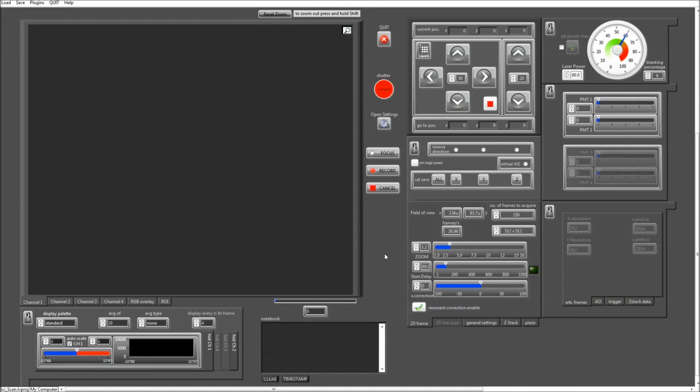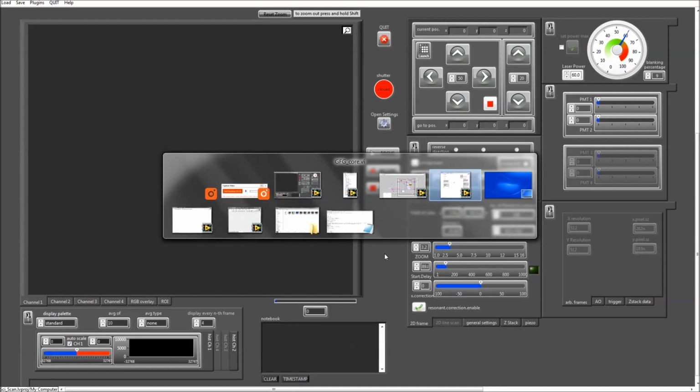Another functionality in the GFG is that it actually generates events whenever one of the variables is changed. That means you can listen for events to occur whenever something changes in SciScan, whether it's a variable, a front panel element, or a frame count in the background. Anything that happens will happen in terms of a change of a variable, and that will generate an event that you can capture in your standalone VI. So let me quickly show you how to do that.